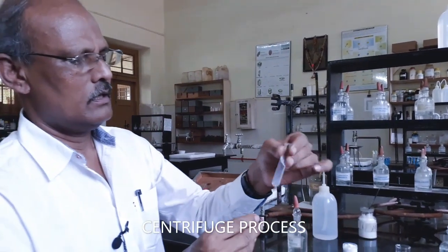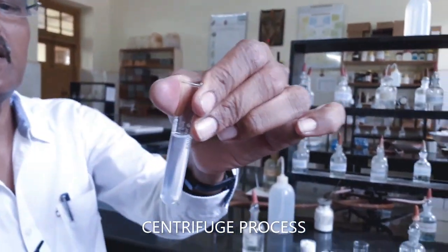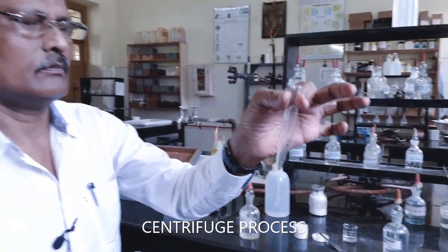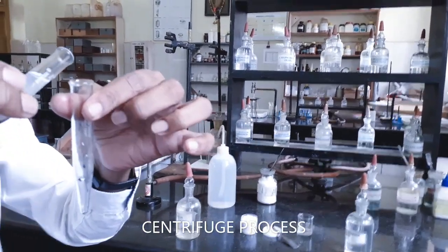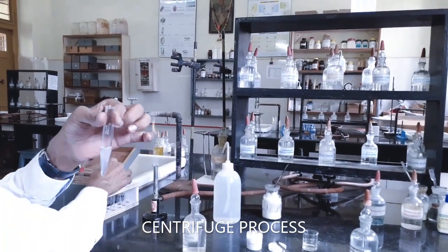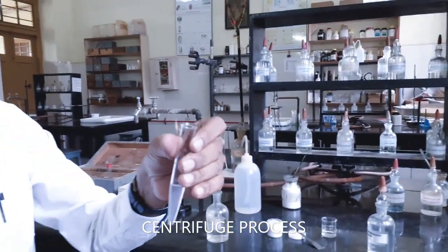Then I centrifuge this. We carry out the centrifuge process in a centrifuge tube. It is a special tube having a cone shape. To this centrifuge tube, I am going to transfer the precipitate formed, and I am going to keep this white gelatinous precipitate taken in the centrifuge tube into a centrifuge machine.